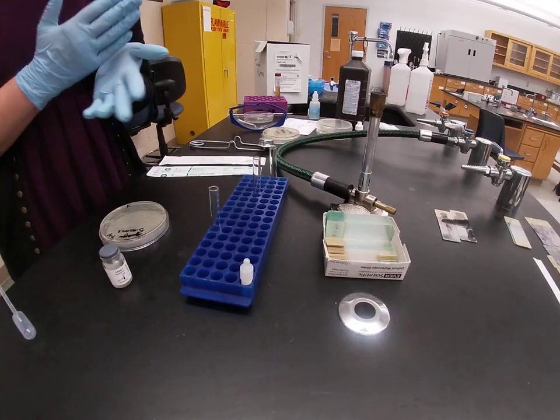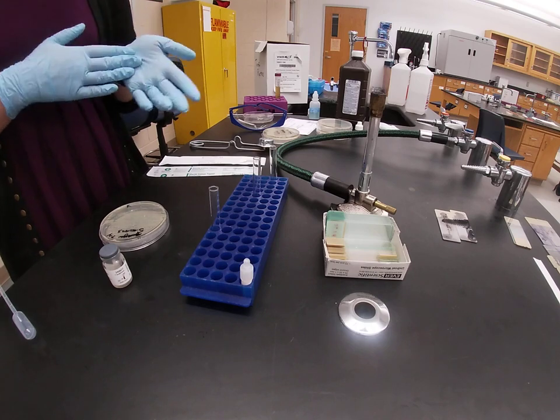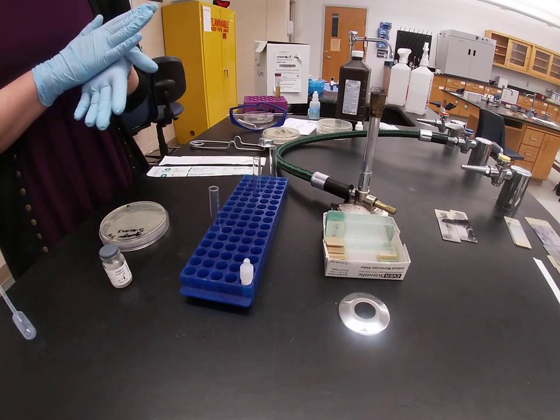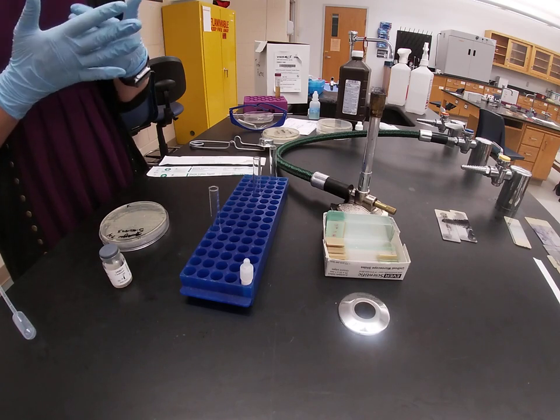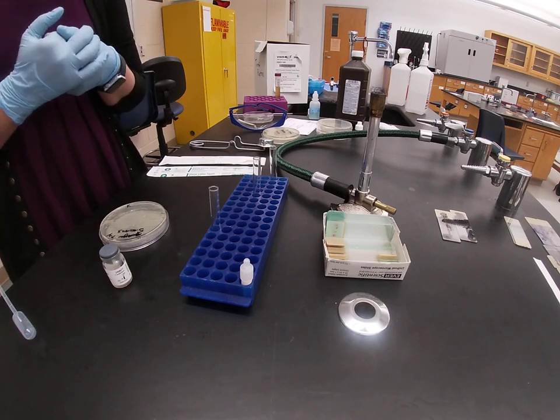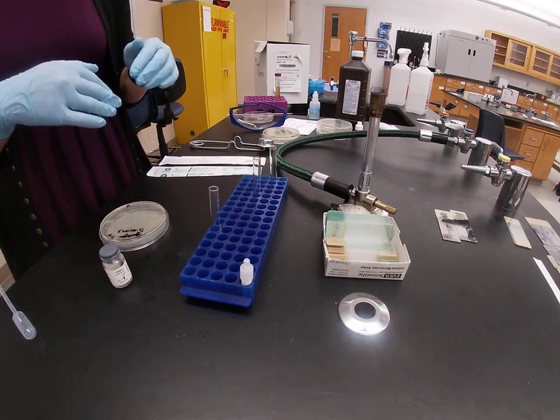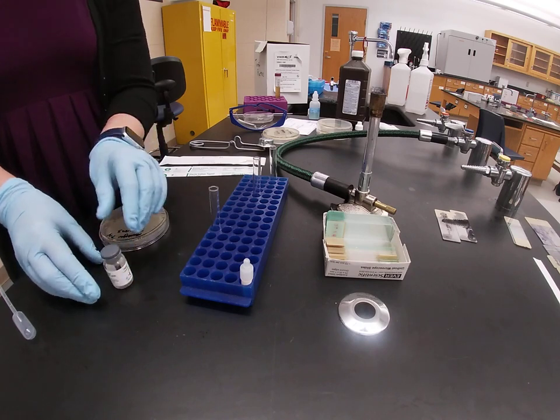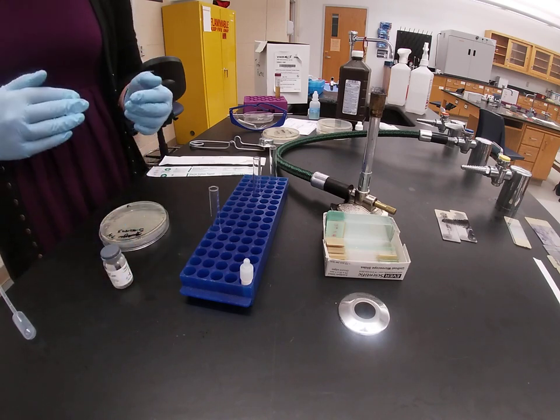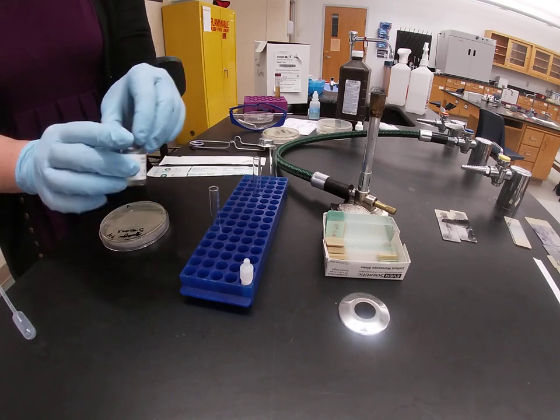In this video, I'm going to demonstrate how to do a coagulase test. Coagulase is an enzyme that some bacteria produce that allows them to bind host proteins, like fibrinogen. When bacteria bind to host proteins, they can use this as a cloaking mechanism to hide them from our own immune cells. To do a coagulase test, so to look for the presence of the coagulase enzyme, we actually use rabbit plasma as our reagent.